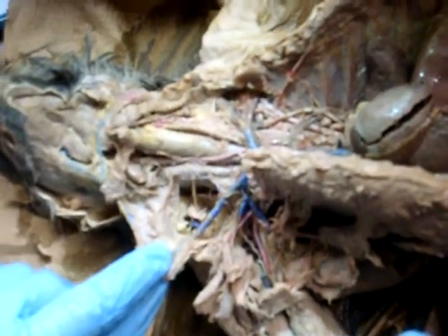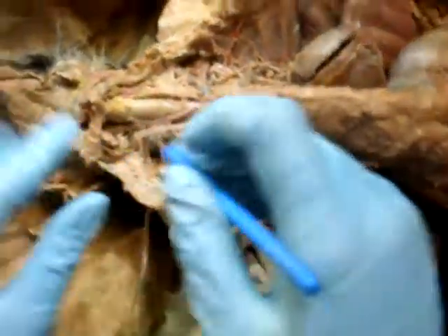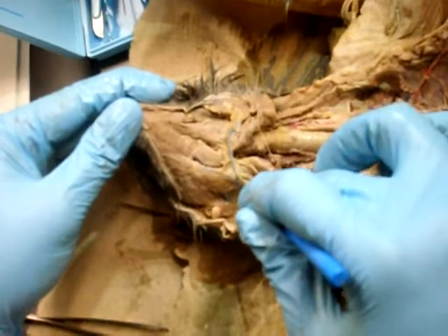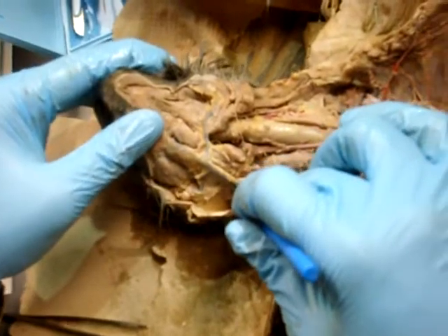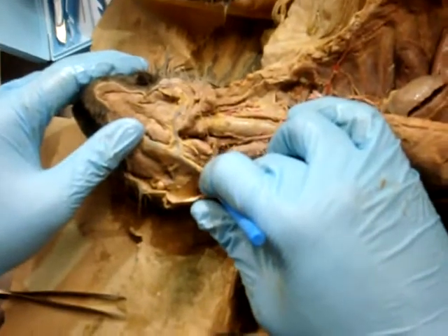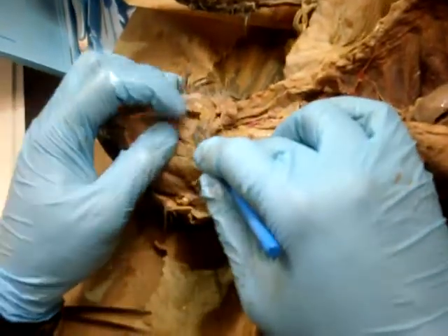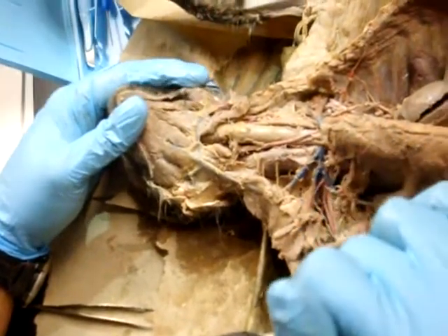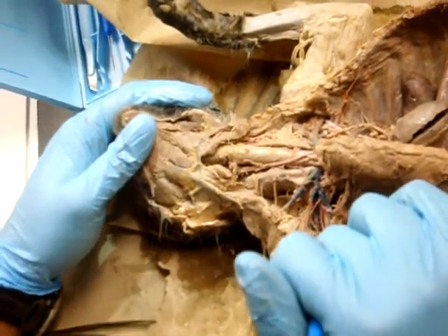Anterior facial, posterior facial, picture cat only. Okay. And then transverse jugular. Yeah, that was obvious. That one's really obvious. Those ones are picture... no, that one is crossed out. Oh, really? You have it crossed out, but on ours maybe it's highlighted? Posterior auricular. Okay, cross it out. But this is the transverse jugular. Guys, cross out posterior auricular on the left side.